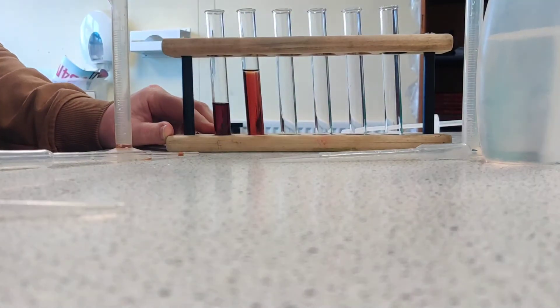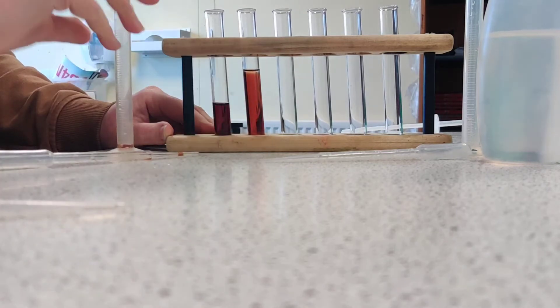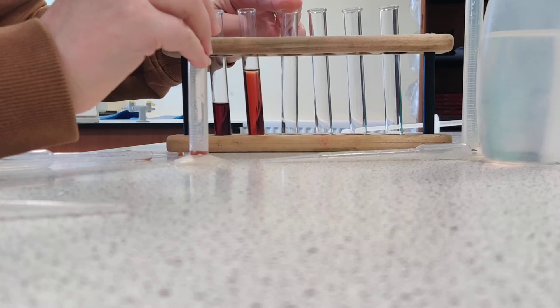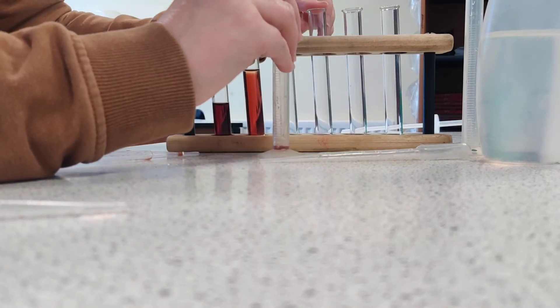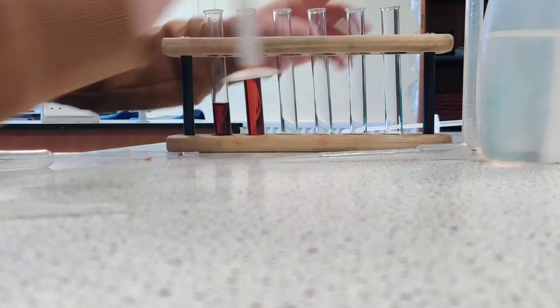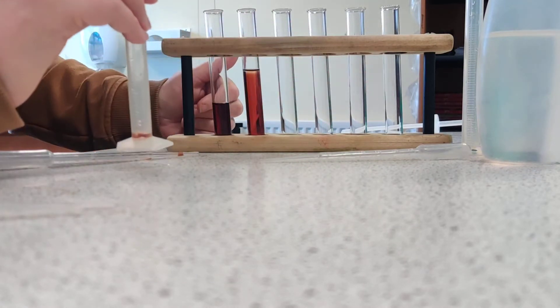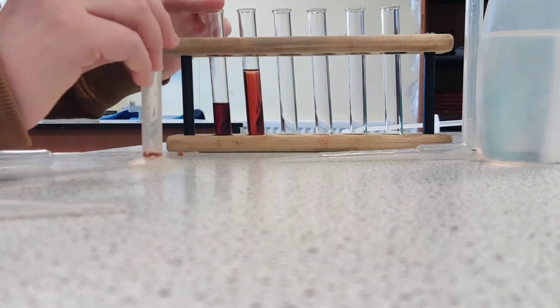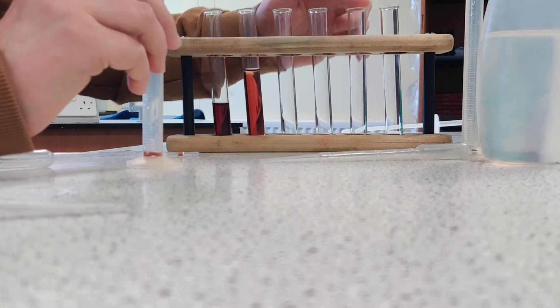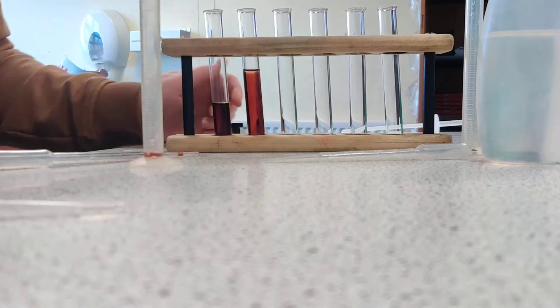I'm going to continue making the serial dilution by now taking half of this — 5 — and adding 5 of water in the next tube. Then take 5 of that one and add it to 5 of water, and so on, so that the dilution is going up by halves, or the concentration is going down by half: 100%, 50%, 25%, 12.5%, 6.25%, 3.125%. And then after that we have our distilled water.